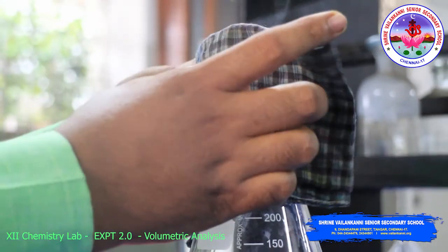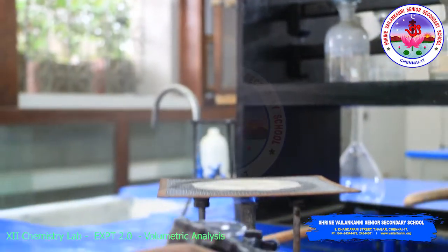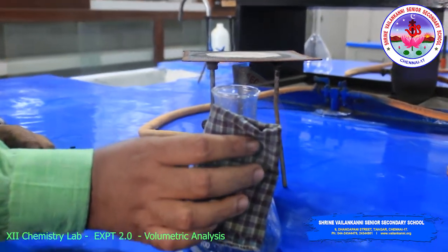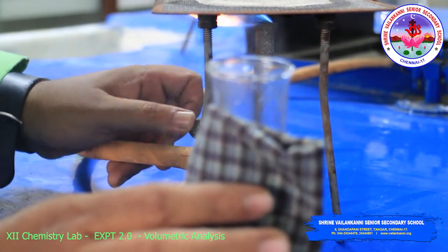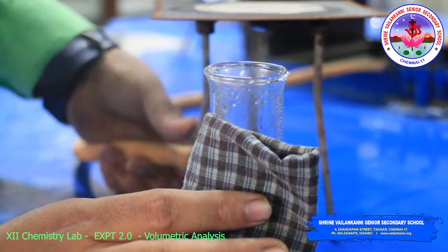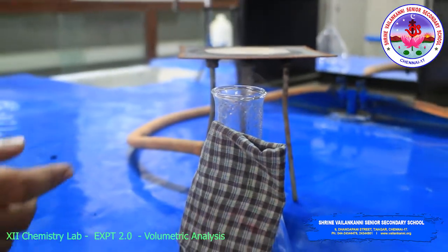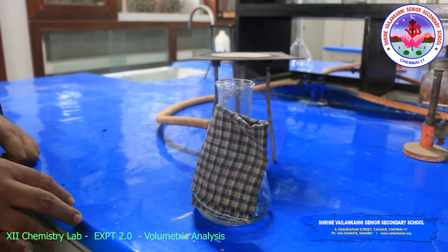When you reach the temperature 60 to 70 degrees Celsius, the carbon dioxide gases will come out. Just keep this. Then after that you have to do one thing that is very important one, off the burner. Then titration against the potassium permanganate solution.